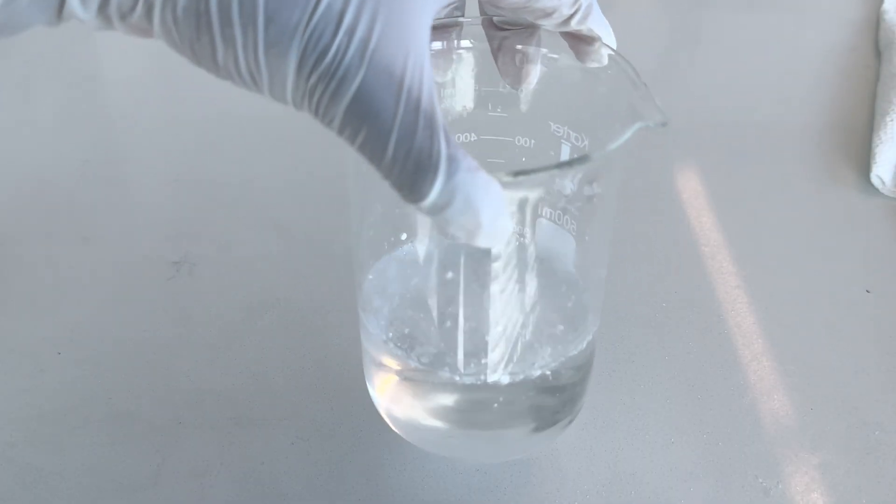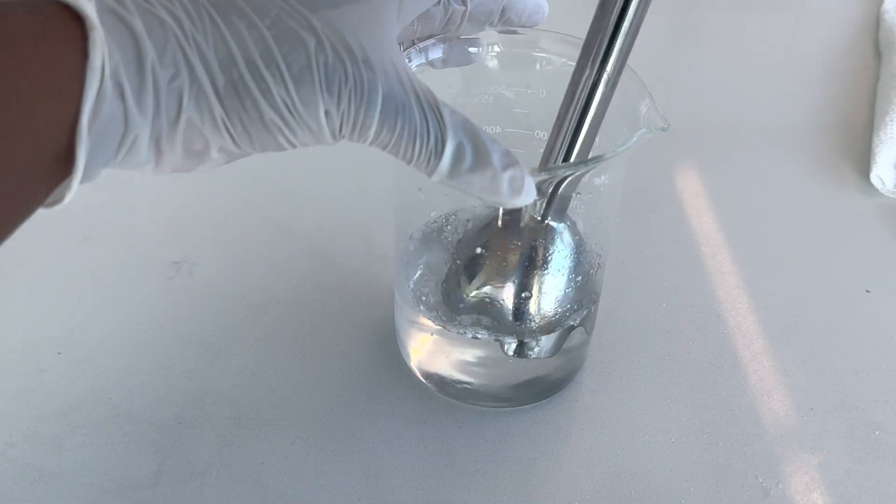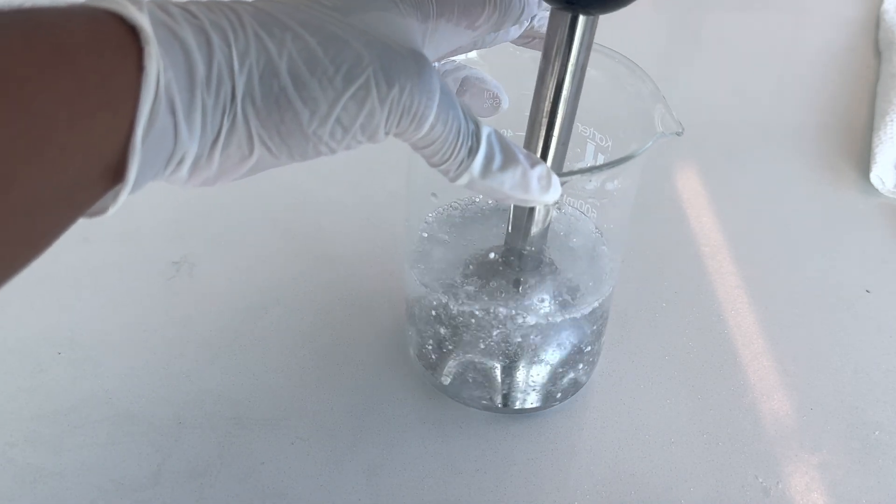I then use a homogenizer to fully hydrate the Carbomer. This process takes about 10 minutes, so you do have to be a little patient.